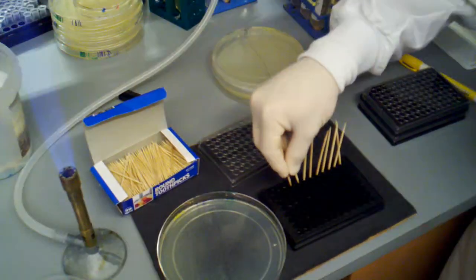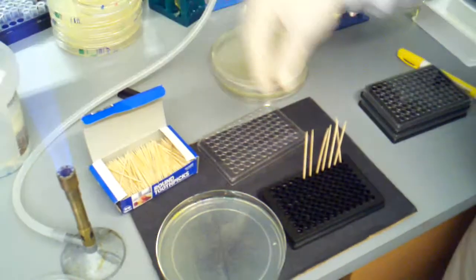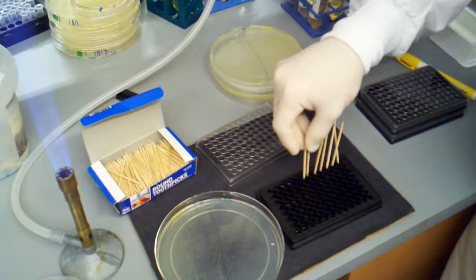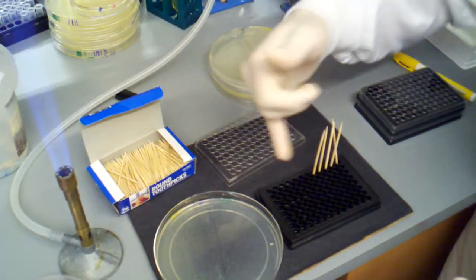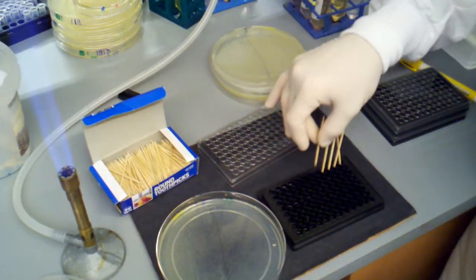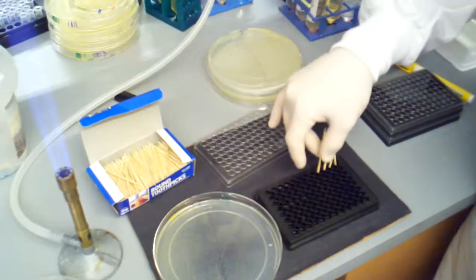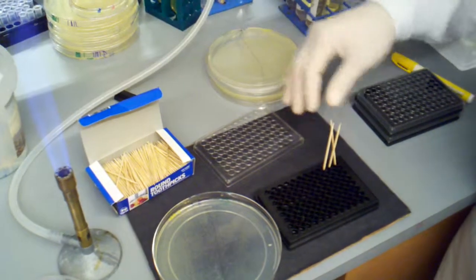But you want to be very careful to not drop them, which is why I only try to get two at a time. If you try to take too much more than that, then you will lose one of your toothpicks, and it might splash into another well and contaminate it. You need to be very careful at this point not to cross-contaminate, because that will mess up the result of your screen.